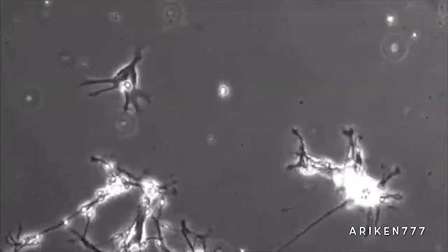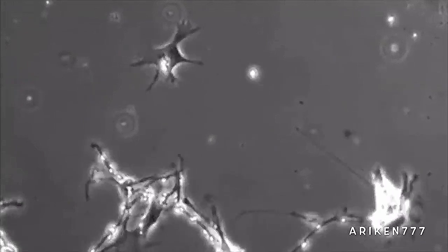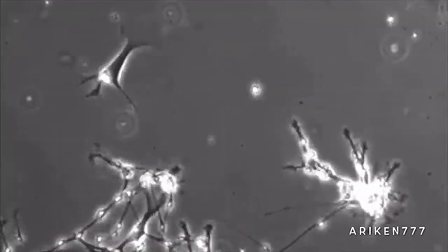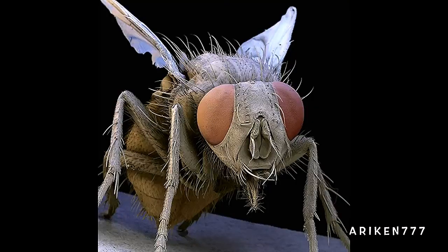This time-lapse video shows neural stem cells in a nutrient medium over a period of 4 hours. The video reveals the dynamic growth and recycling of dendrites and synapses as neurons establish relationships with each other. A common housefly.